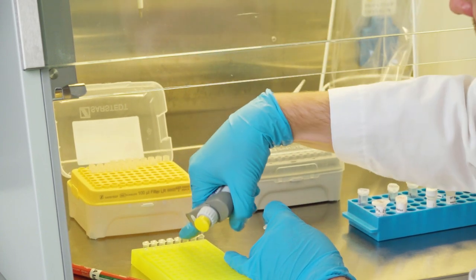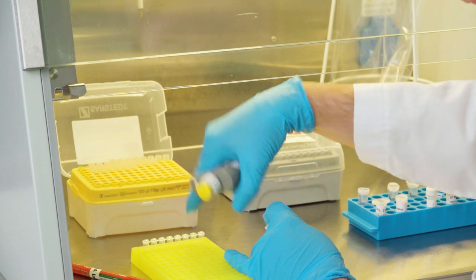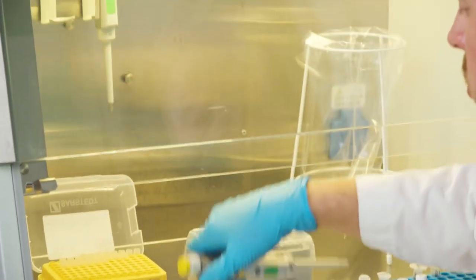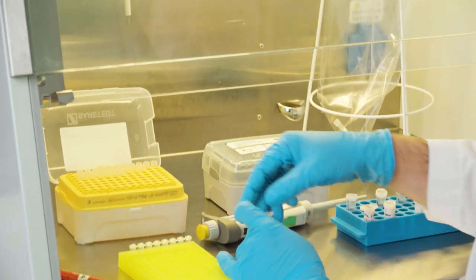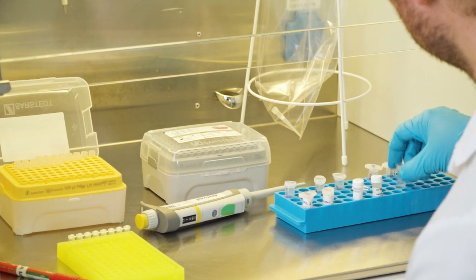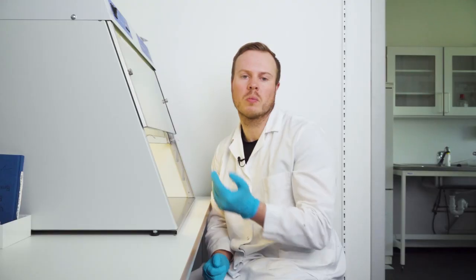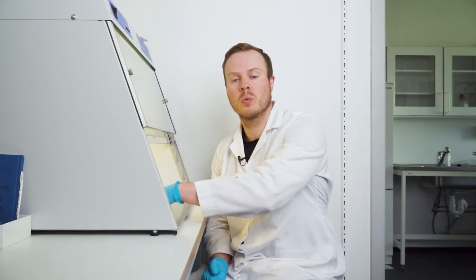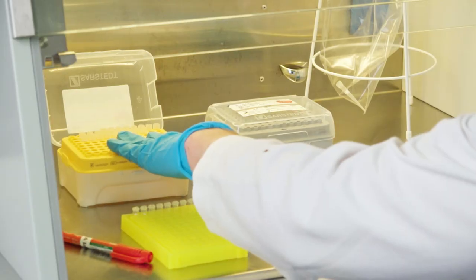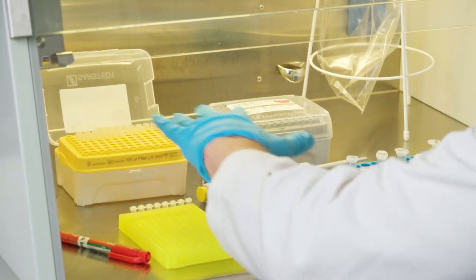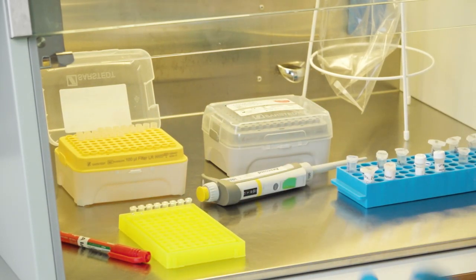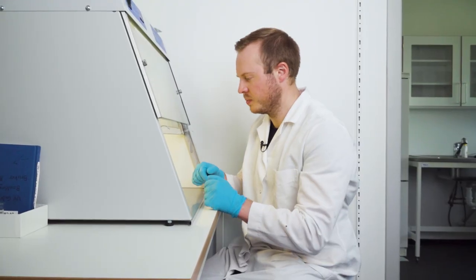So when you have done all the samples in one row, for example, or in two rows, then you can put the master mix back and take a new pipette tip. I like to do it one row at a time, because then I can use the boxes or the pipettes in the box to see where I am. That's my preference.